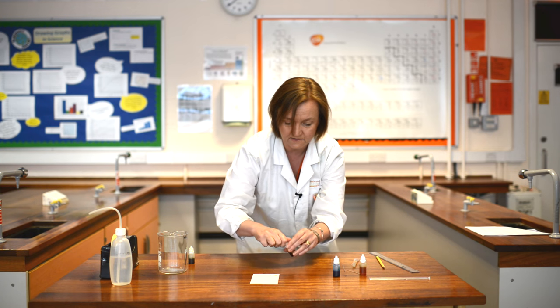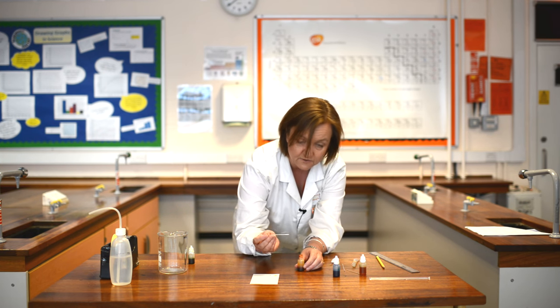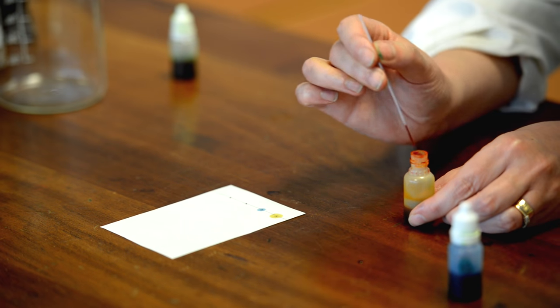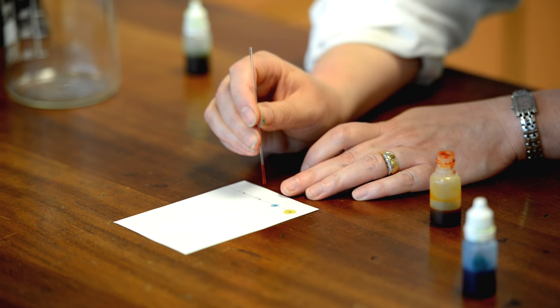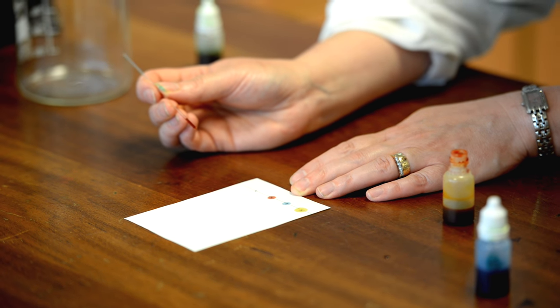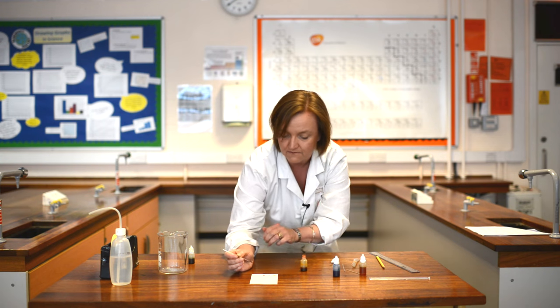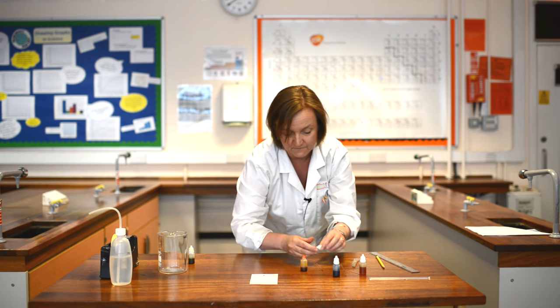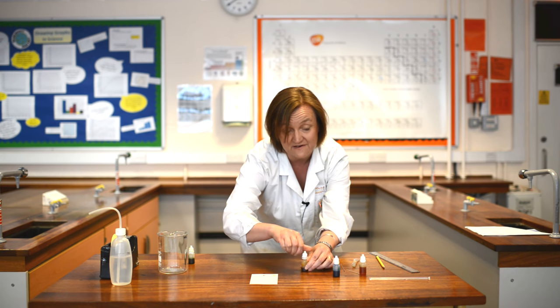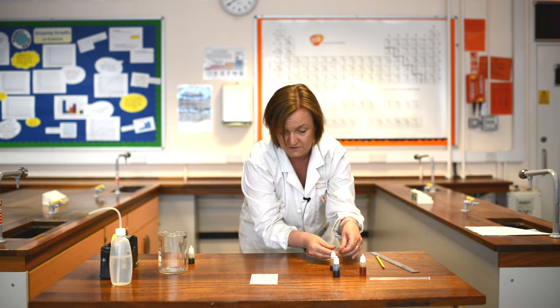Thirdly with my red, which is my final pure color. Notice I'm using a different capillary tube each time so that I don't cross contaminate my colors. Put some red onto my third one. With the red again I need to make sure it doesn't merge into my blue dot, and ideally we would definitely need these to dry in between the applications of the dots.